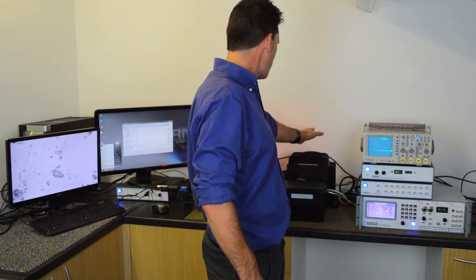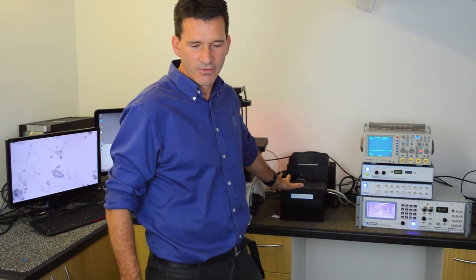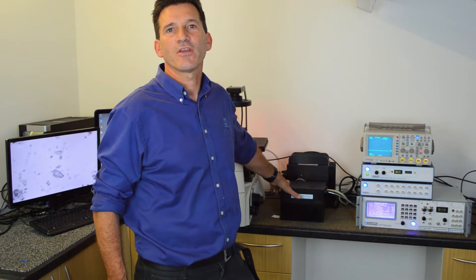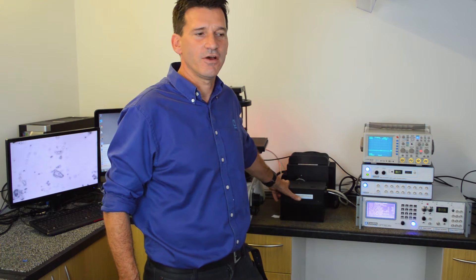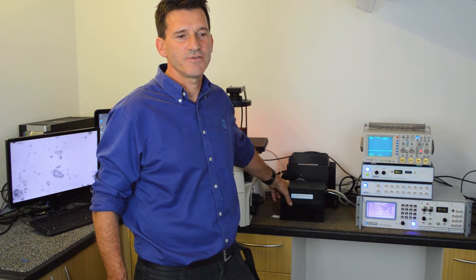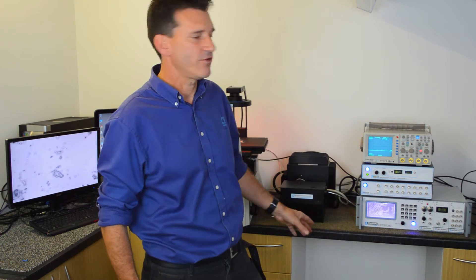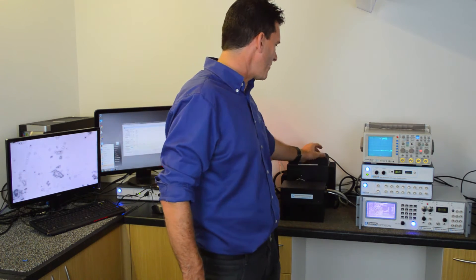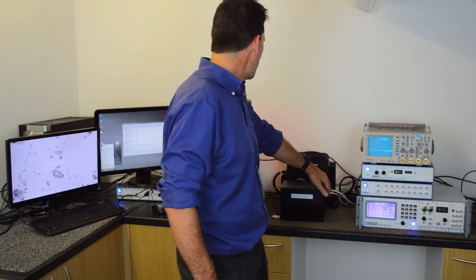The light source is focused into a monochromator device, the Cairn OptoScan, which generates very specific bandwidths and wavelengths of light with millisecond time resolution and switches very rapidly between them, which is exactly what you want for these kinds of measurements.